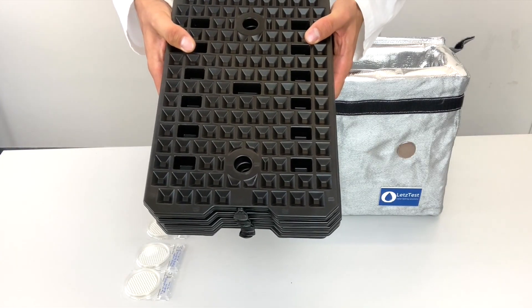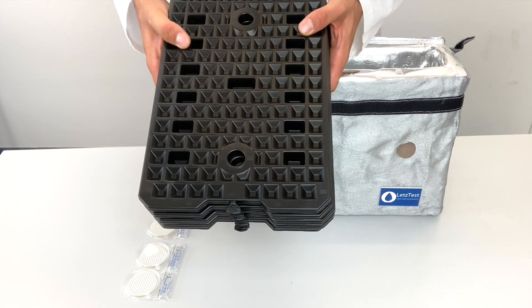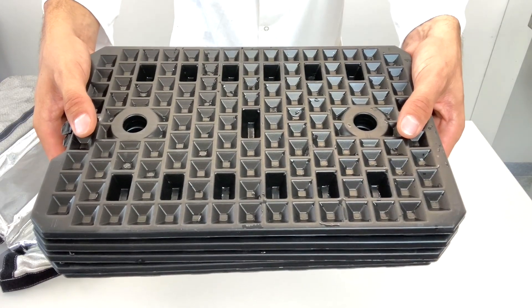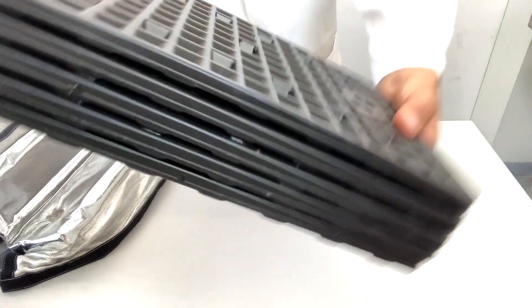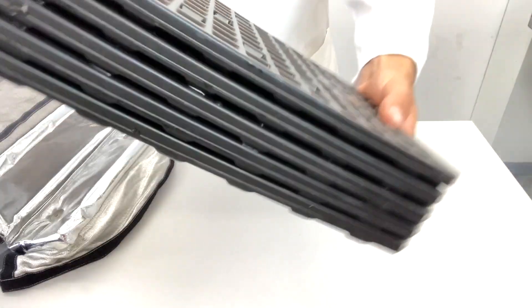As a first step, these plates must be activated. Activated means that all the substance inside the plates is liquefied at a temperature above 37 degrees.